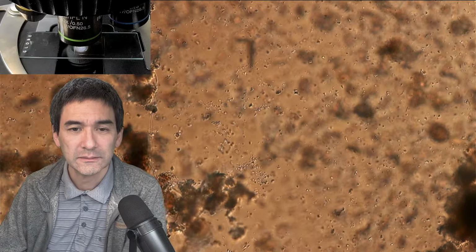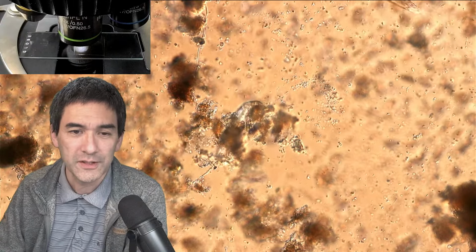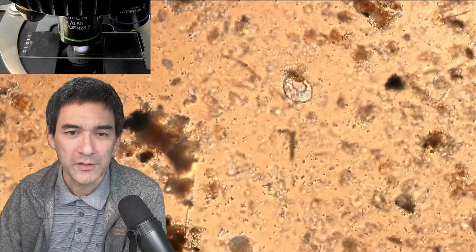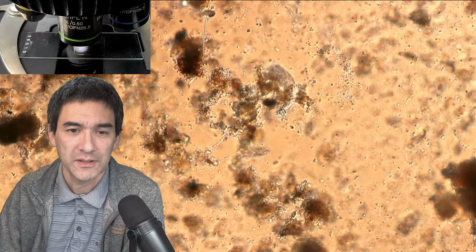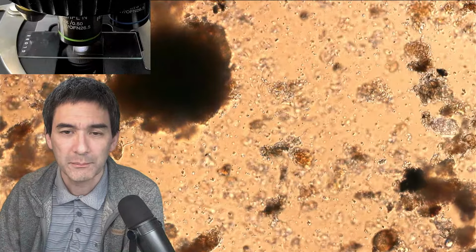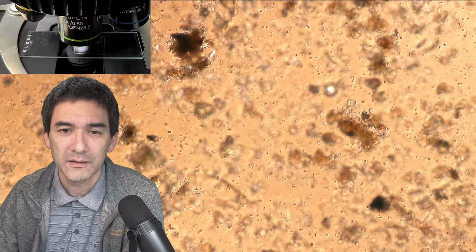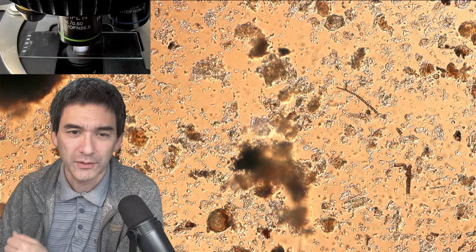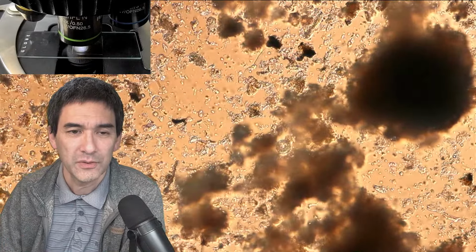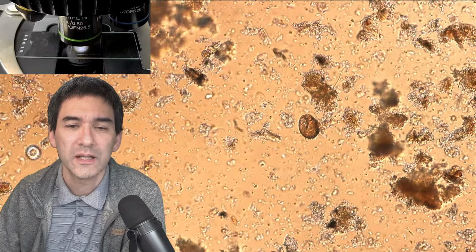Usually, if you're into hobby microscopy, what you very often hear online is, I like to observe water samples and so on. Of course, water samples are nice, but you don't always need water. Sometimes decomposing material is good enough as well. It's a very dense sample, but there are rotifers. I'm always kind of surprised that there's only a very tiny amount of water on the wood, and this is evidently still enough for them to catch food. Stuff whizzing about. It looks like an egg here in the center.